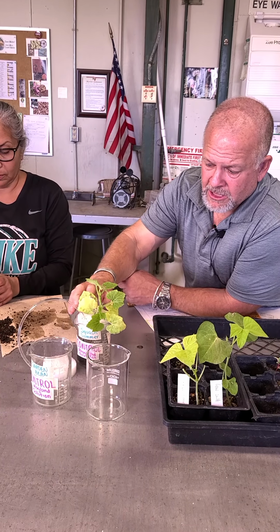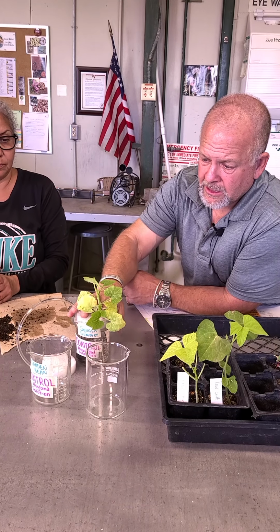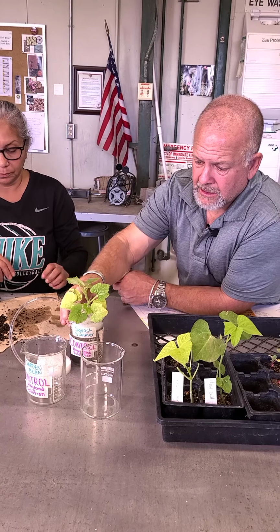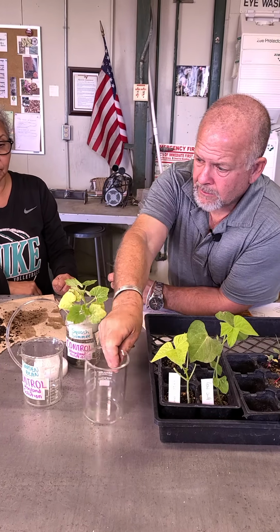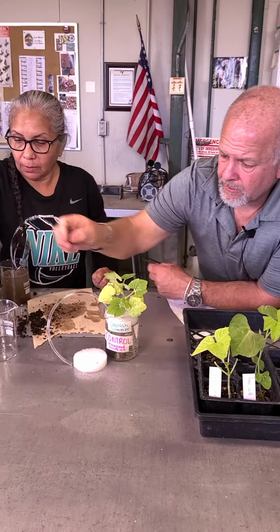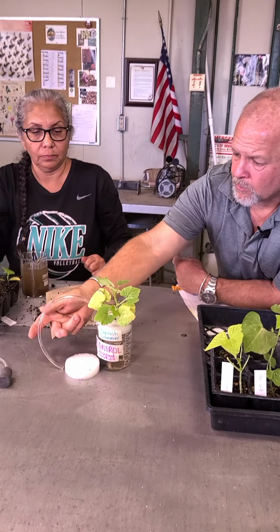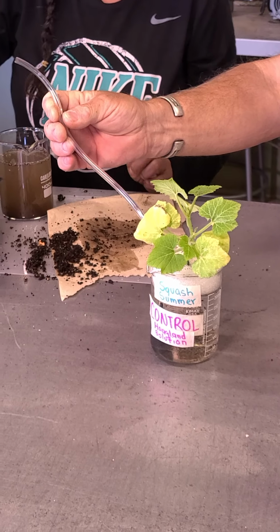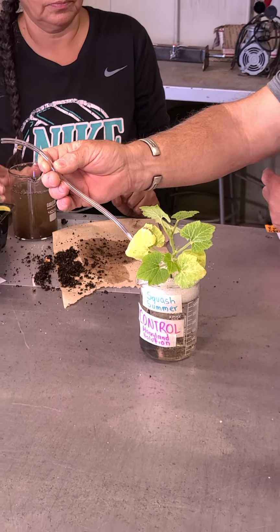So it's pretty much just as simple as this. We go ahead and put these things down. They can be a little sideways. They're not going to really care. Stick those guys down like that, and I can move this out of the way so you get a better look for it. And there we go. So we'll go ahead and connect this end to the air hose line that we have in there, and this guy will be ready to go.